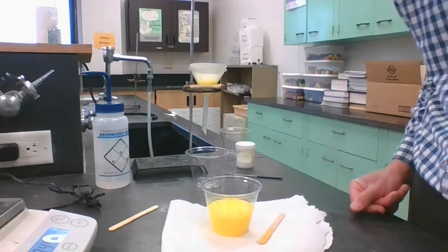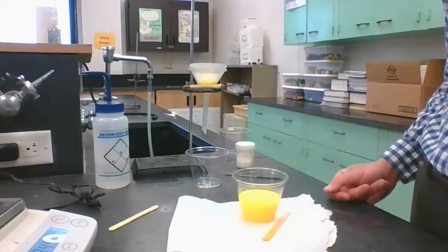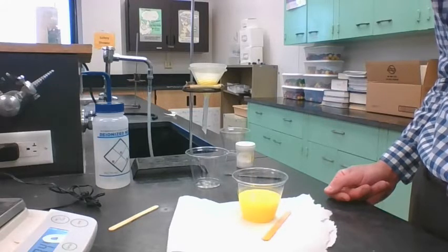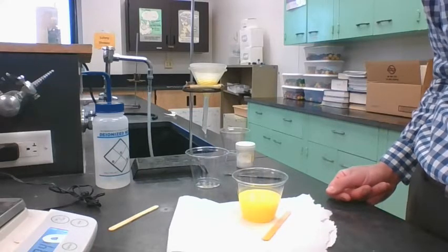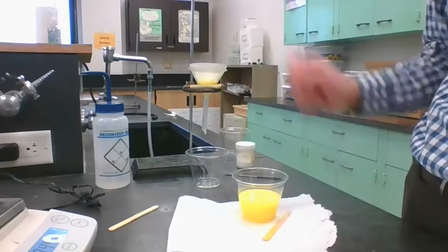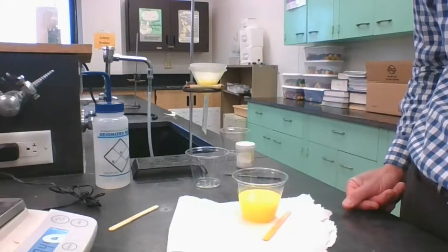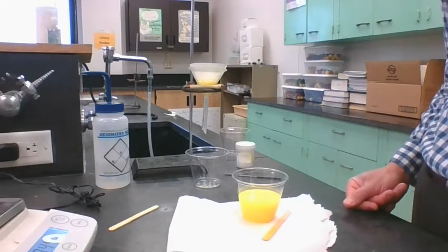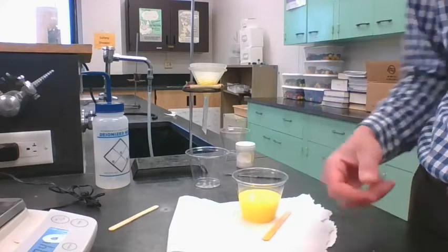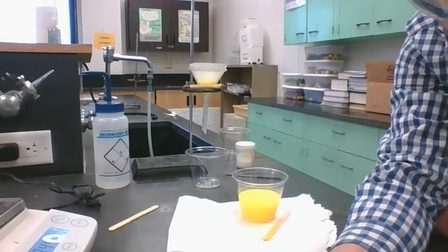And that looks like what I got. It looks like I got pretty clear water coming through at the moment. Okay, dripping, draining through. So that's good. That's a good start anyway. Okay, so hopefully we're collecting our yellow solid in this. The filter paper is catching the yellow solid. Okay, and I'm going to pause the video here and finish the rest of this, and then you don't need to watch this, and then we'll come back.